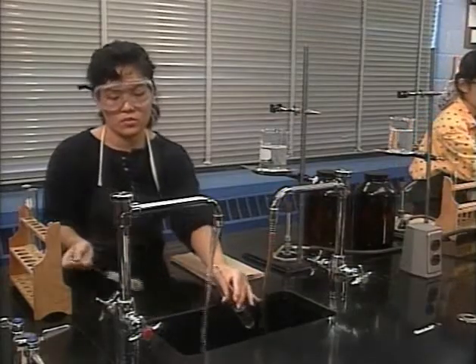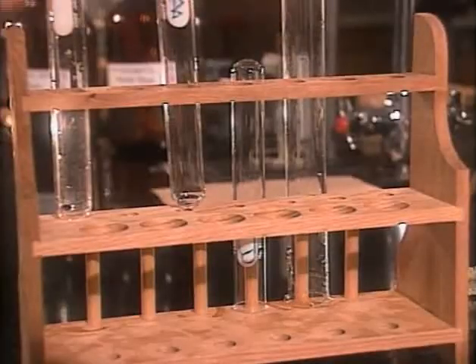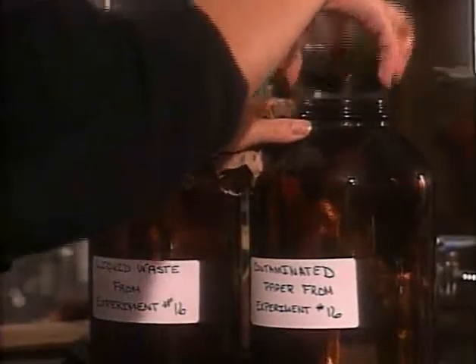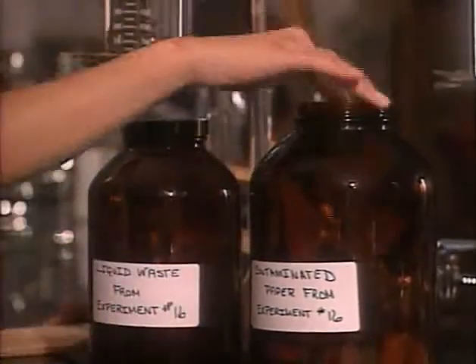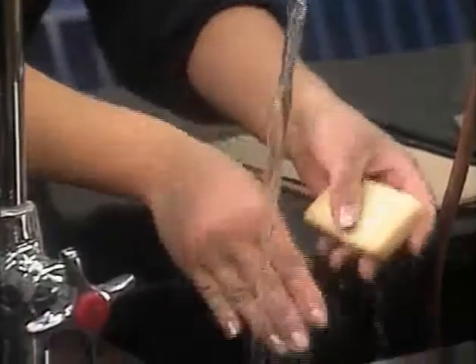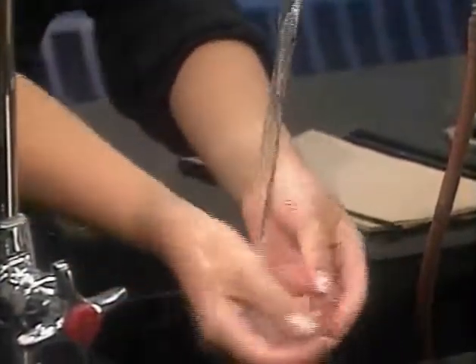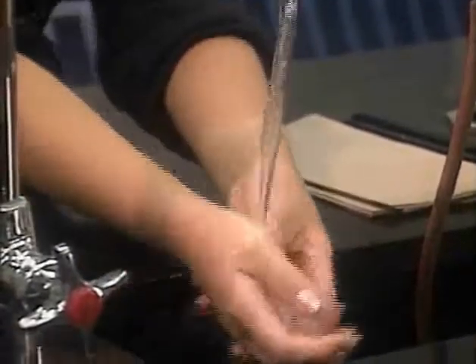The last chemical handling safety rule is to clean up when finished. Glassware should be thoroughly scrubbed and rinsed so it's as clean as possible for the next experiment. Liquid puddles or powders left behind on the lab bench can get on the next person's clothing or skin — wipe them up thoroughly and throw the paper towels in the proper container. Clean chemicals off your hands before leaving, as there may be invisible residues that could damage your skin or contaminate your food.